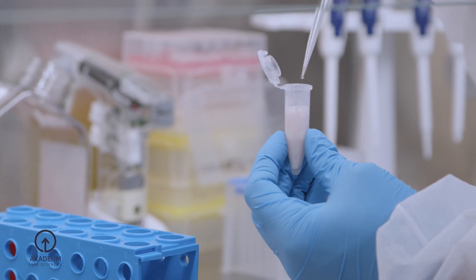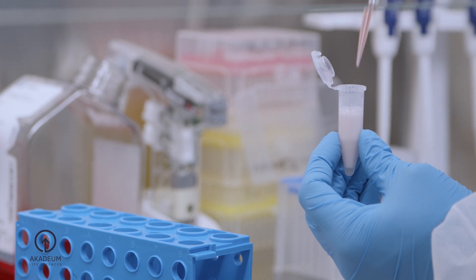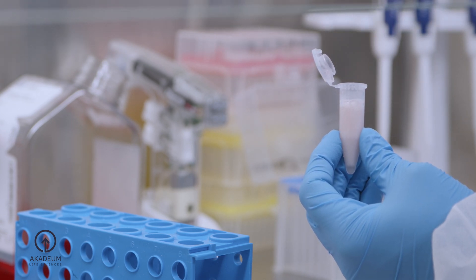Add additional media to ensure even and sufficient mixing occurs in the next step. For bag-based protocols with lower cell numbers, it is also useful to add air to aid in the mixing.